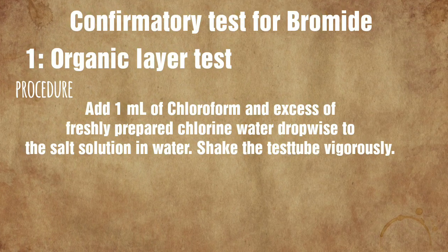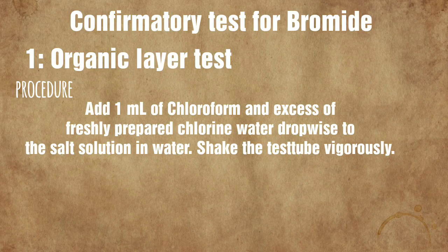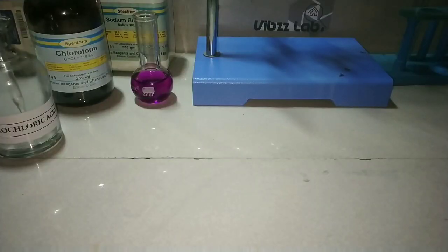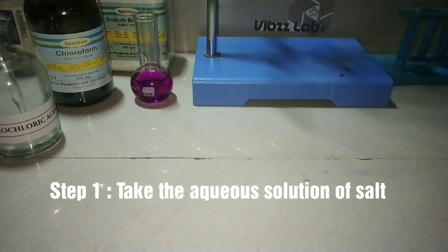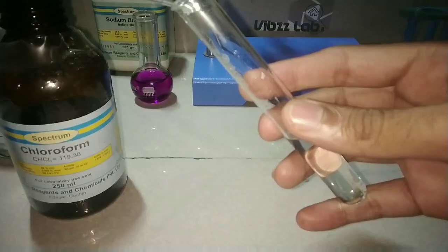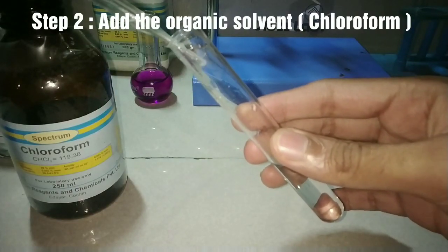The first confirmatory test is the classical organic layer test. We will be adding chloroform and chlorine water to the aqueous solution. The first step is to take the aqueous solution of the salt — take a generous amount of solid salt to make the solution a little concentrated. The second step is to add the organic solvent.